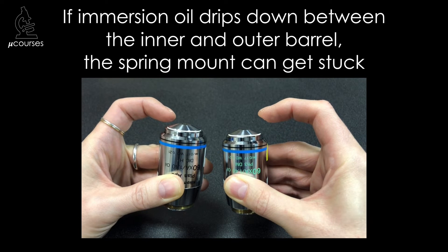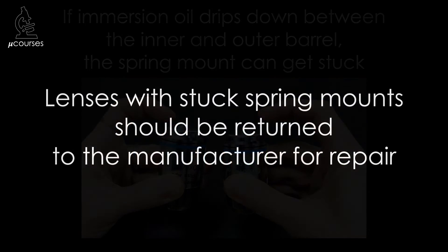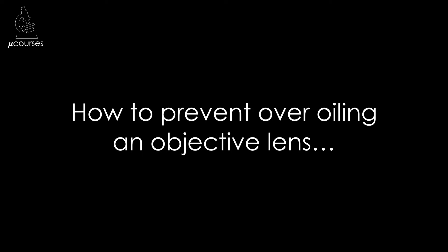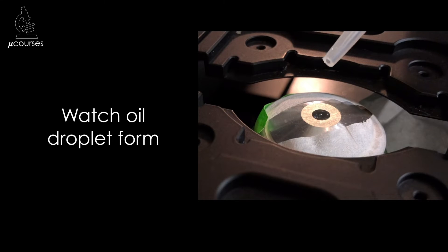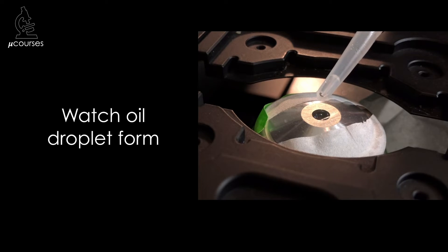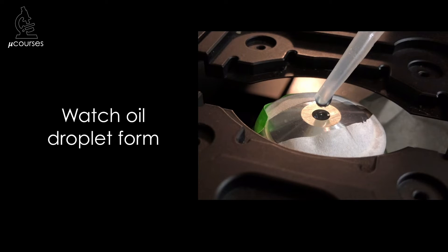So no matter how much pressure you place on it, it will not retract. To minimize the risk of breaking samples when focusing, you should return a lens that has a stuck spring mount to the manufacturer so it can be repaired. You want to make sure you're not using too much oil on the objective lens. The way to do that is to turn the oil dropper upside down — don't squeeze it. Let gravity pull the oil to the tip of the dropper and watch for that oil droplet to form.